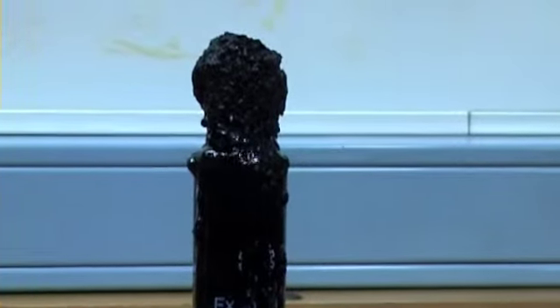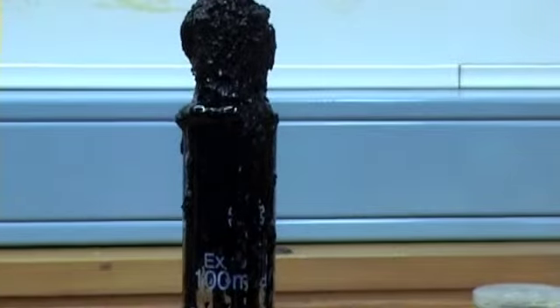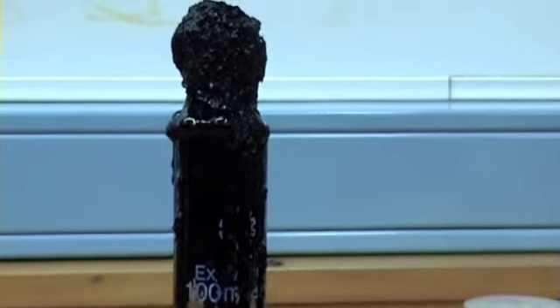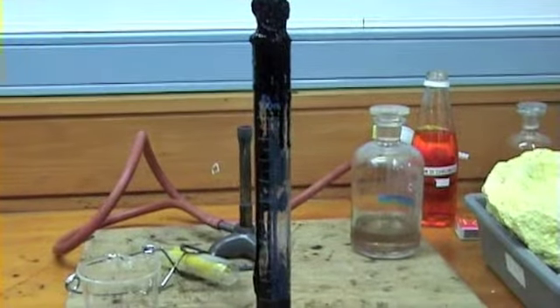Well, here we go. He's going to the second part. I'm gonna push it. Push it out. Push it out. Push it. Push it. Oh my god. You can see what I mean about the measuring cylinder probably not being very useful afterwards.